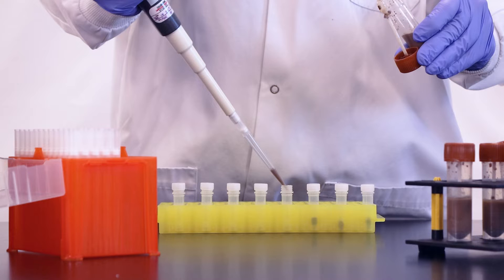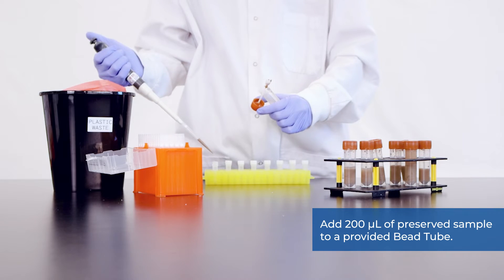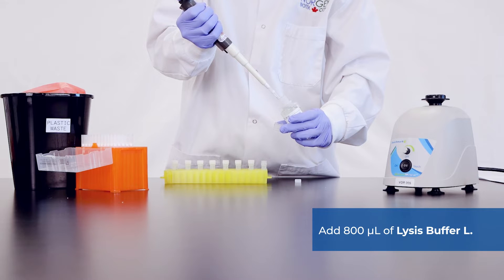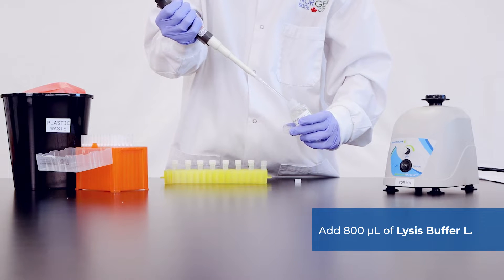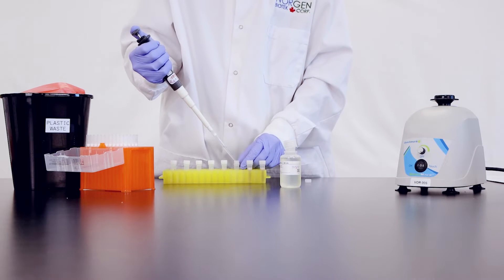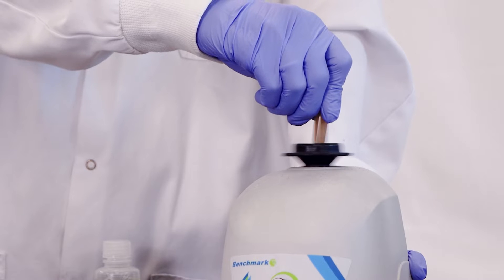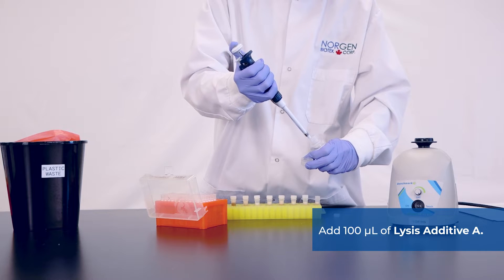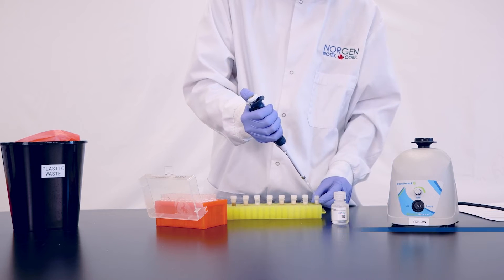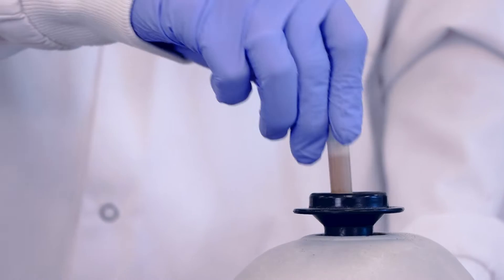To prepare your stool samples, add 200 microliters of preserved sample to a provided bead tube and add 800 microliters of lysis buffer L. Vortex briefly to mix stool and lysis solution. Add 100 microliters of lysis additive A and vortex briefly.